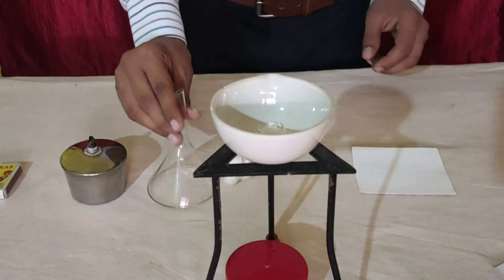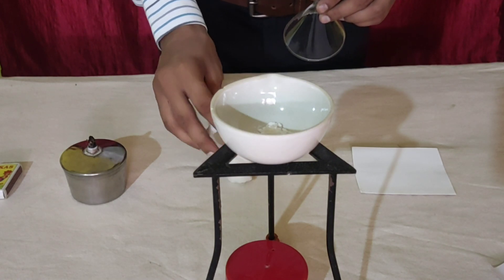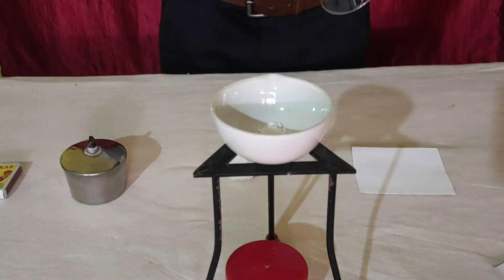Now, take a funnel, plug its nozzle with cotton. Invert this funnel on china dish.